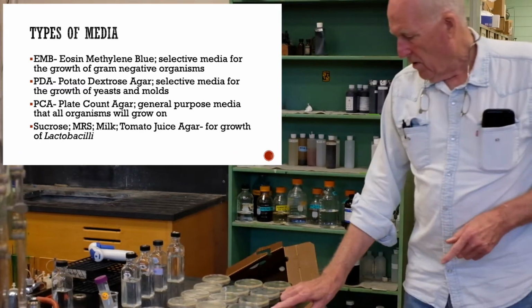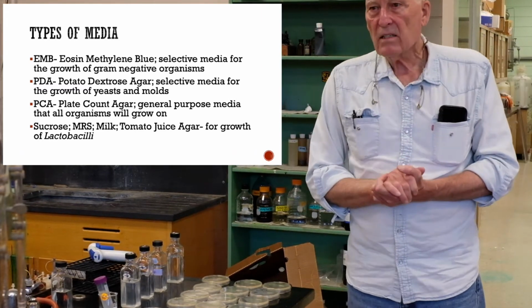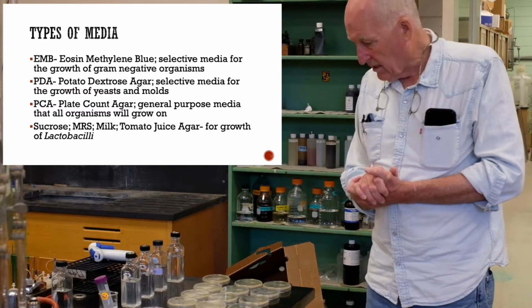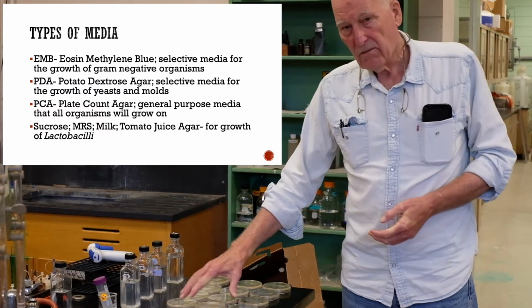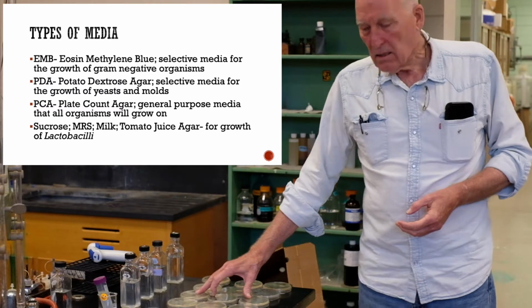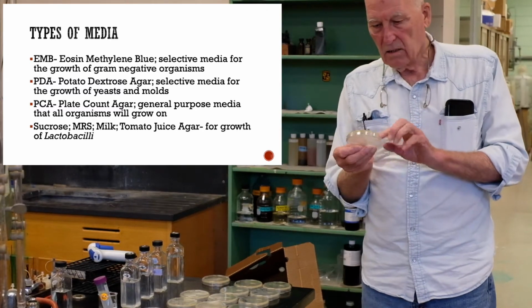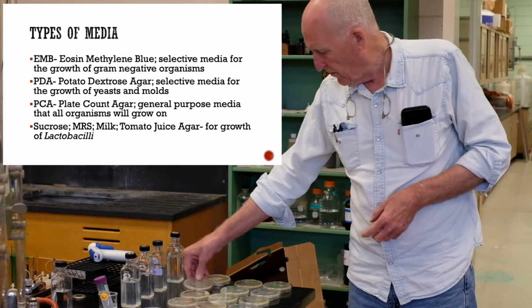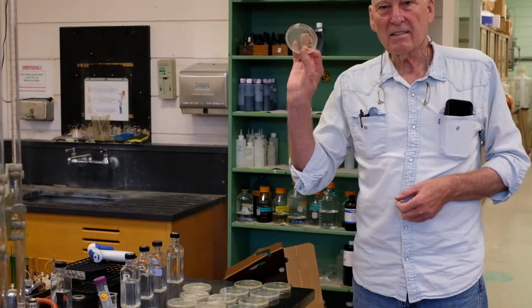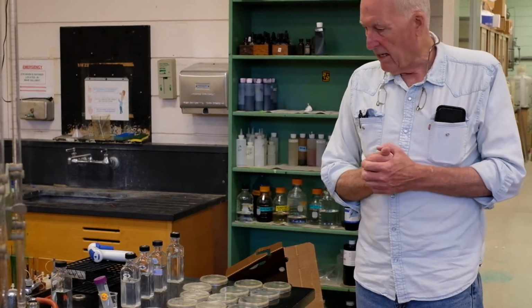And then I have 4 types of enrichment media for the various lactobacilli that we expect to isolate. They have different names. We have sucrose. We have something called MRS. We have one that's got milk and so forth in it. And look at this one, tomato juice agar. Each one of them is specialized for different types.